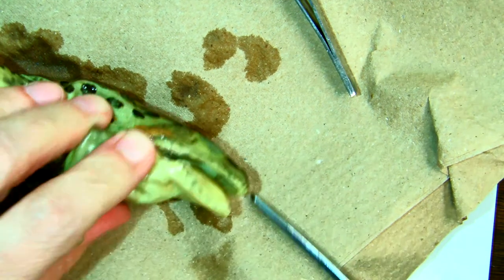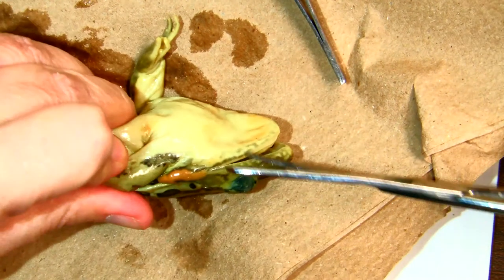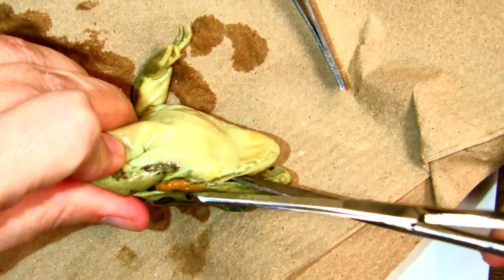So we are going to do the same thing to the other side. Just put the sharp part in here. Be careful not to cut yourself.